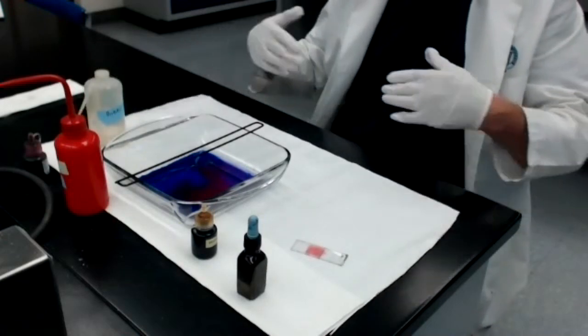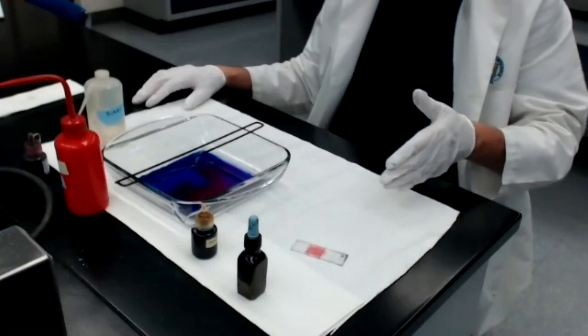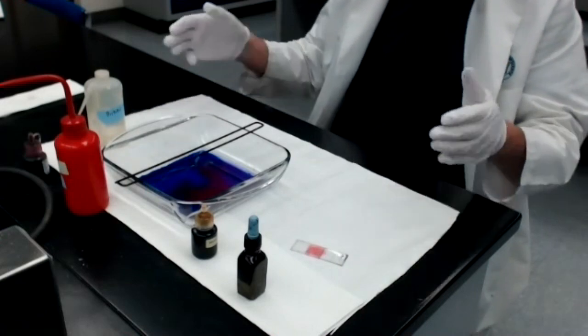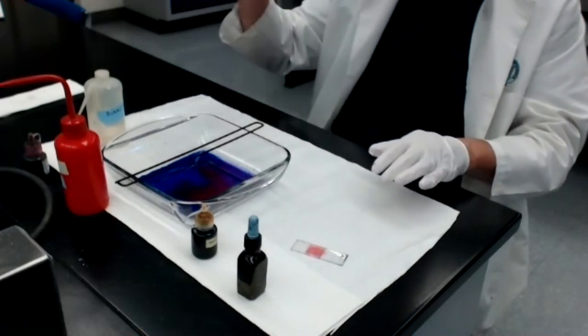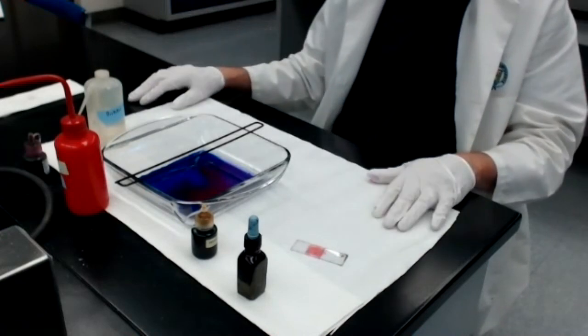That's it. I'm not going to show you the focusing of the scope. I showed you that in part 2 of the Module 5 video. Again, I'm going to dispose properly of this solution. I'm going to put it in the waste bucket. I'll get everything off the island, and then I will disinfect the island, and we'll finish up and leave the lab.